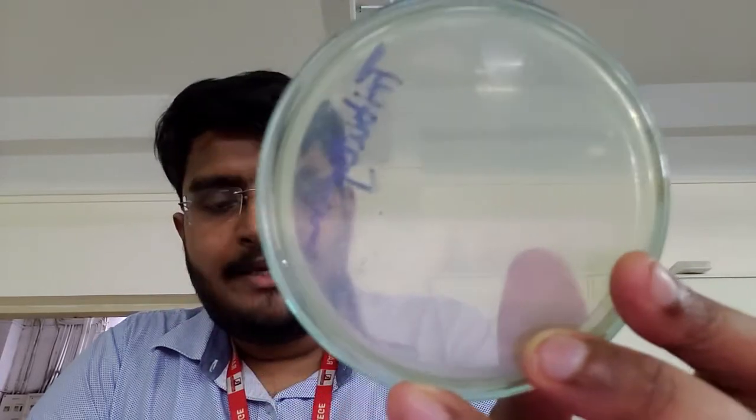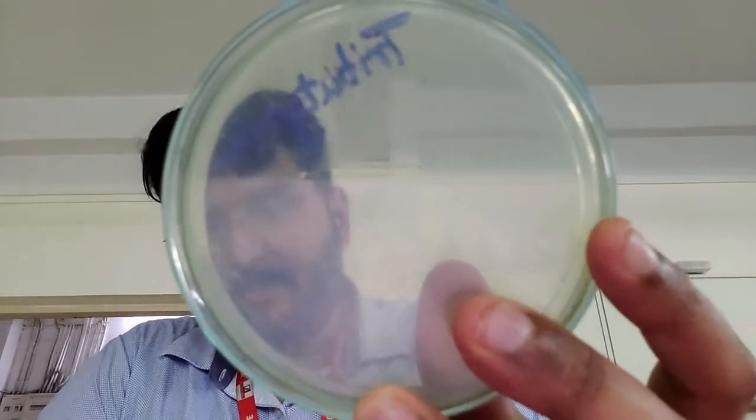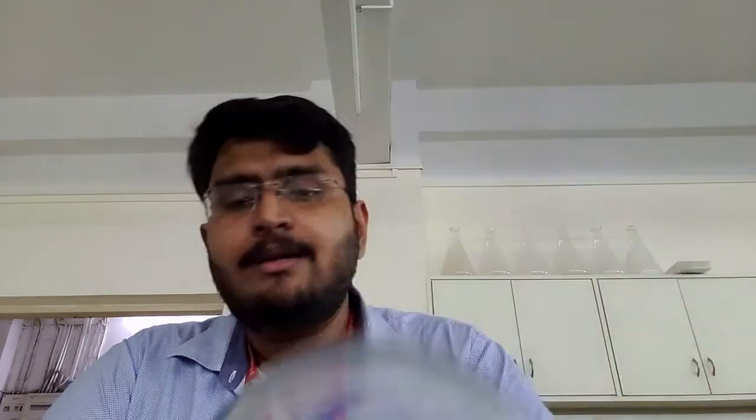These droplets are basically of the lipid, and this is because lipid is not completely miscible or soluble in water or any aqueous medium, so you end up seeing oil droplets on the media. That's actually the best way of identifying the plate — you can see that there are a lot of oil droplets on it. I'm going to go ahead with the isolation, put it for incubation, and 24 hours later we'll see what happens.